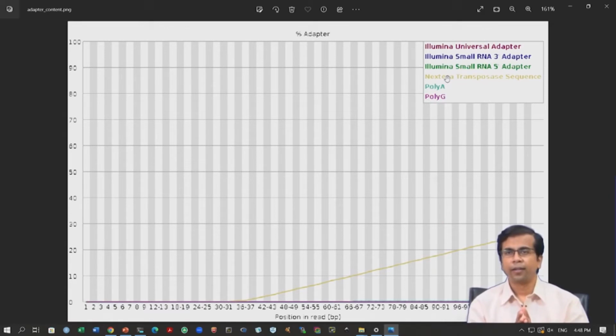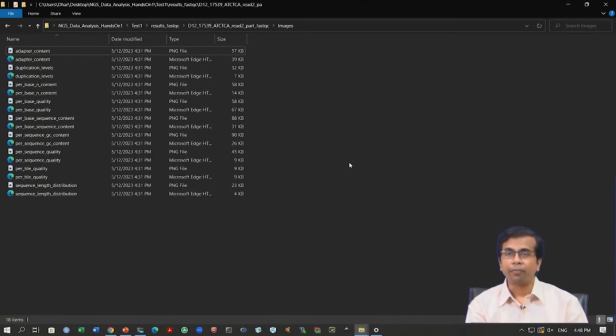So, the data quality score wise looks great, right. We have checked, there is no warning, no issues, but there are a few problems, right. One is the adapter content. Okay. So, this is something that we need to address before we actually go for any downstream analysis, okay, and this is where the pre-processing step will come. Okay. So, let us now go into the pre-processing step.